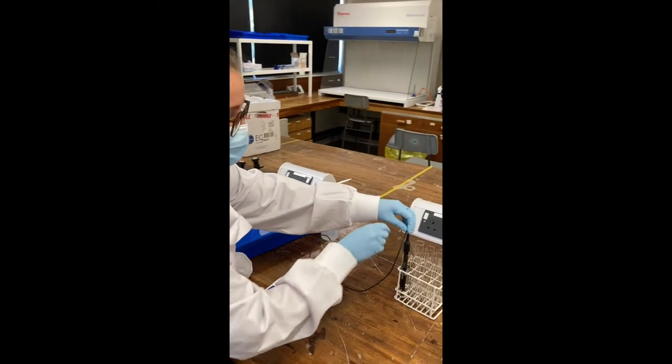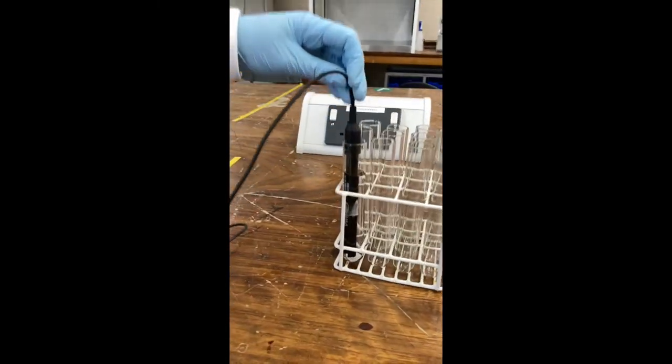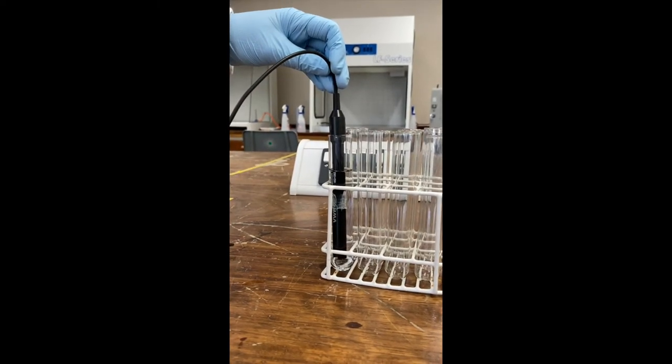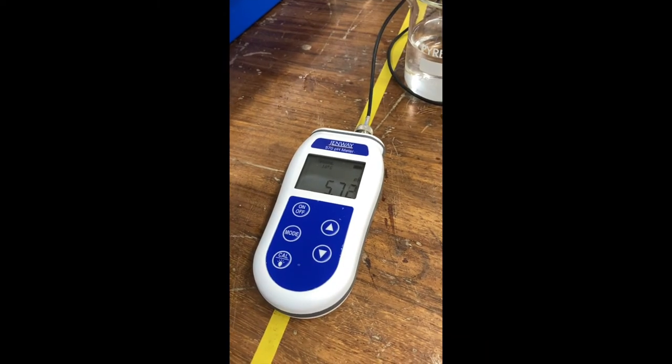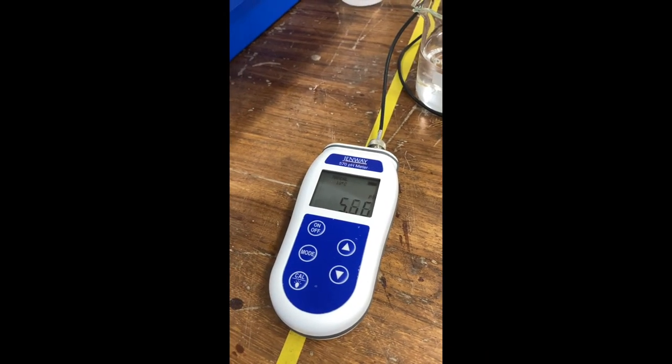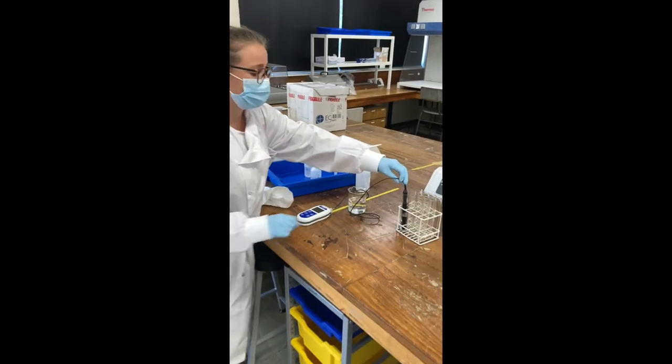fully submerge the probe in your sample, and then wait for the numbers to settle. You don't have to press anything else at that point, and record the value. And that's that.